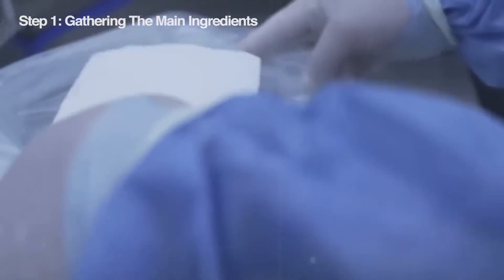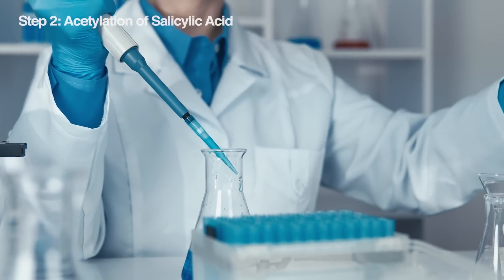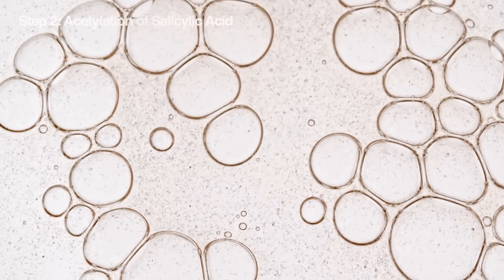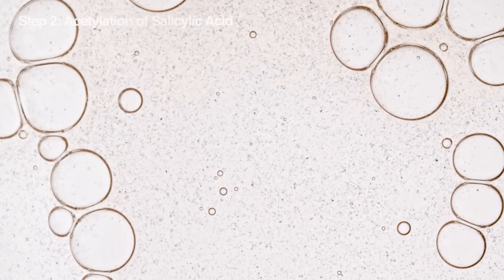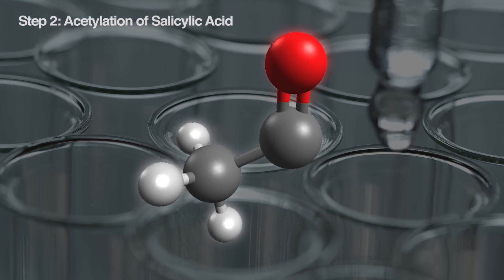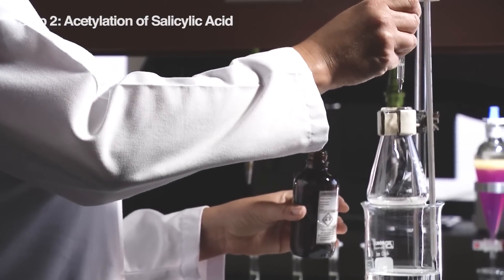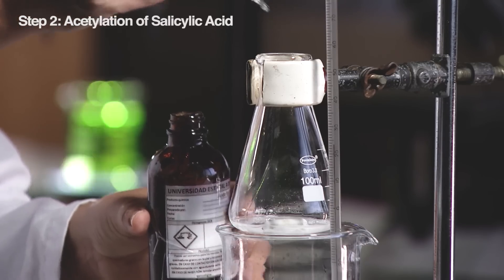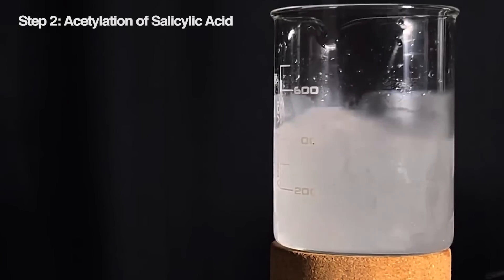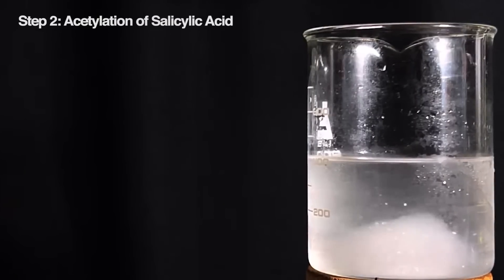Now that we've assembled our ingredients, let's head to the factory and see how this transformation takes place. Acetyl groups can attach to other molecules, changing their properties and functions. In this case, they attach to salicylic acid, transforming it into acetylsalicylic acid — the active ingredient in aspirin. It may seem small, but the acetyl group packs a punch, shaping molecules and their roles in many chemical processes. The catalyst also joins the mix, creating the perfect environment for the reaction, acting like a conductor directing the action. Like two old friends, the acetyl group and salicylic acid bond, forming a new compound — acetylsalicylic acid, or aspirin.